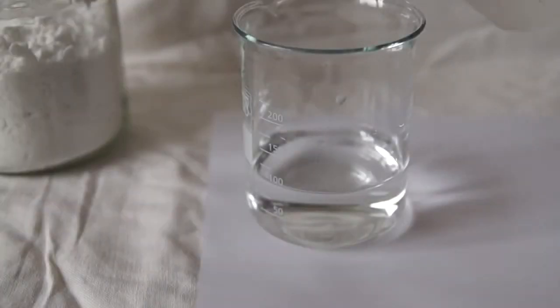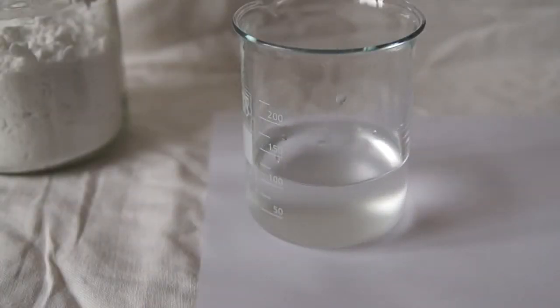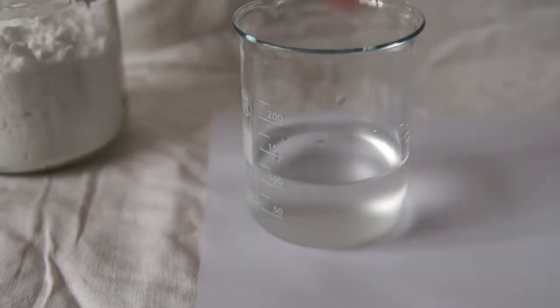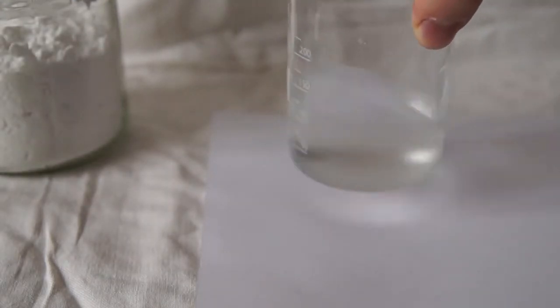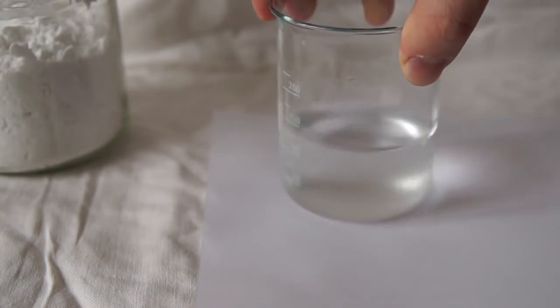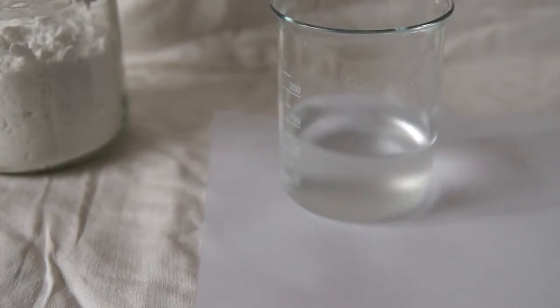Next, pour the starch solution into the first solution, where we have a mixture of potassium iodide and sodium thiosulfate. We get a slightly cloudy solution.